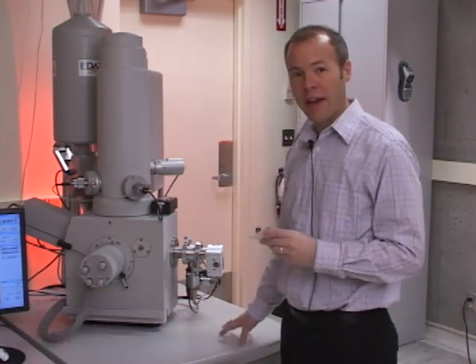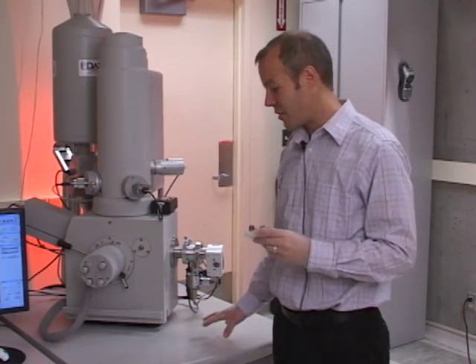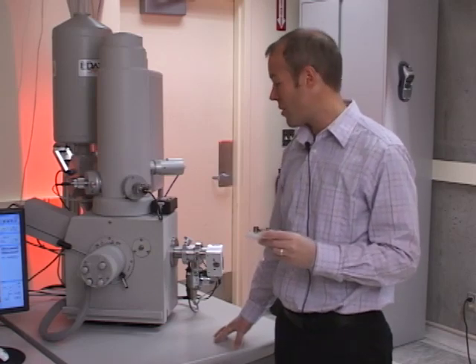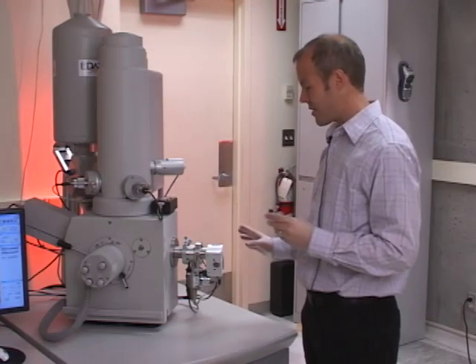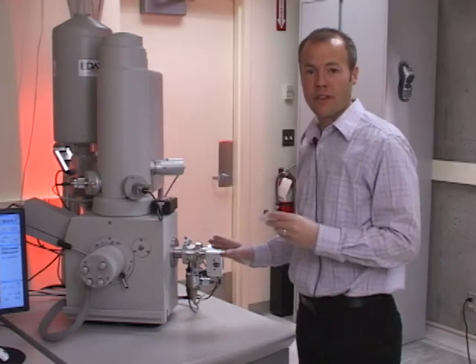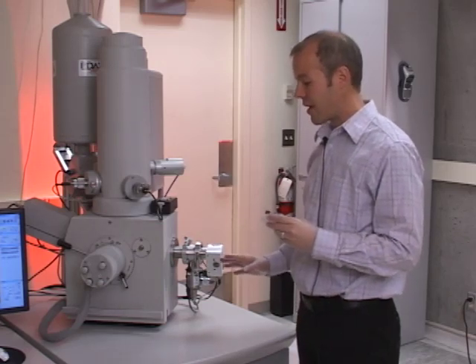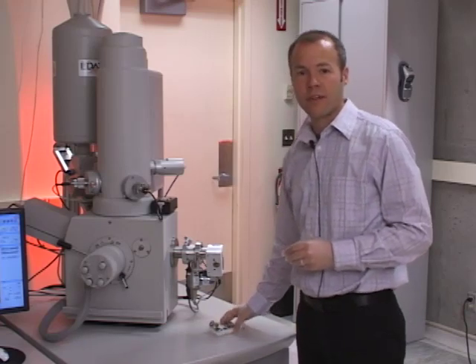But it's actually a really bad idea to try and use this as a work surface because any vibrations that you create by putting things on this tabletop are going to be transmitted to the sample. And also there's a lot of delicate equipment actually attached to the chamber, and we don't want to accidentally remove any of these wires or cause any damage. So the only thing I use this table here for is to set the samples while I wait for the chamber to vent to atmosphere.